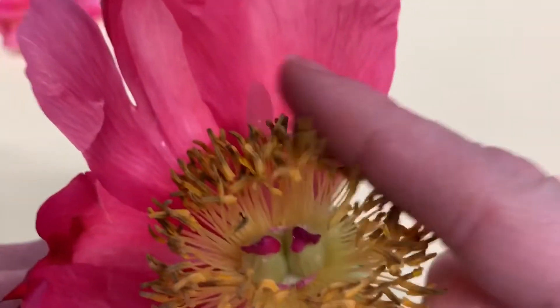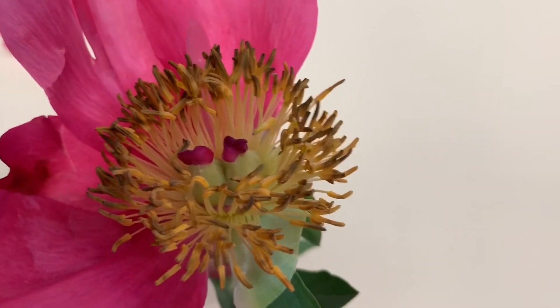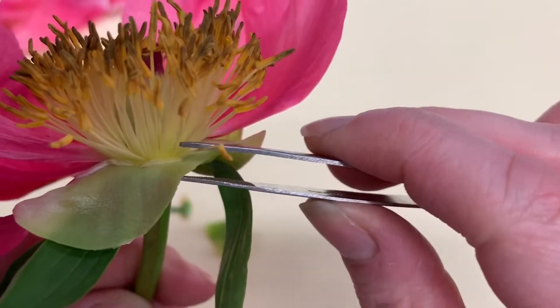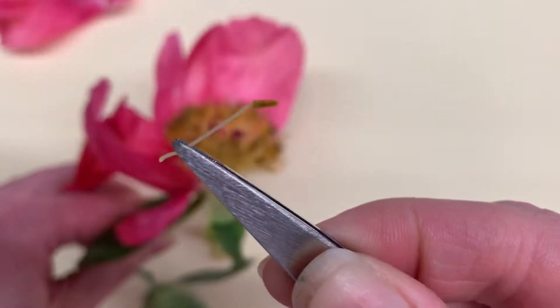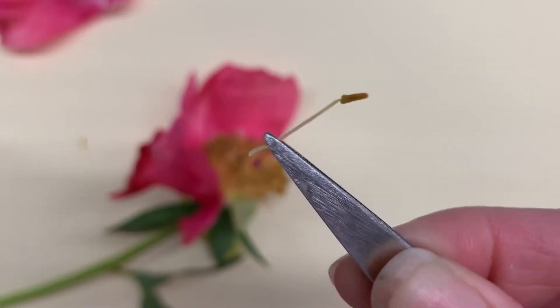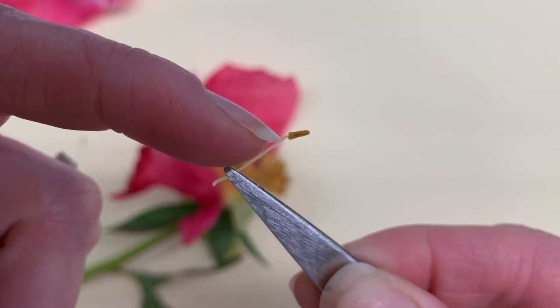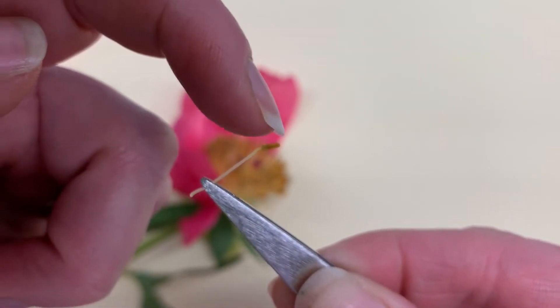The male reproductive structure is called a stamen — this entire piece here is a stamen. This section is the filament, and this is the anther. On the anther is where all of the pollen is produced.